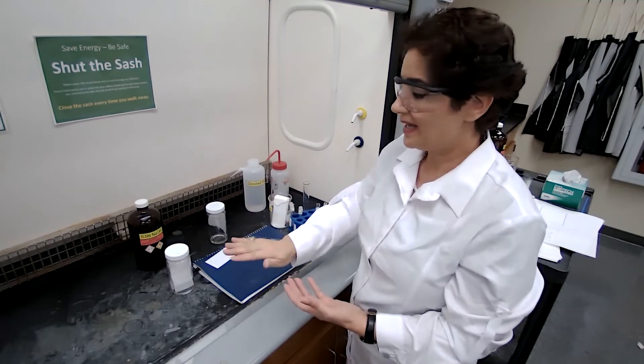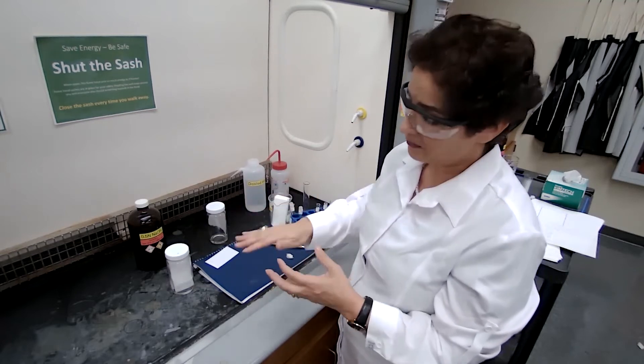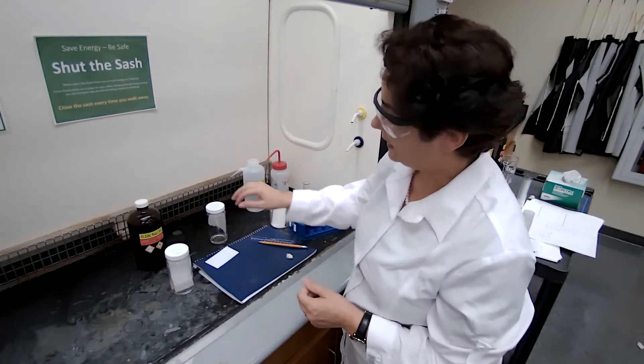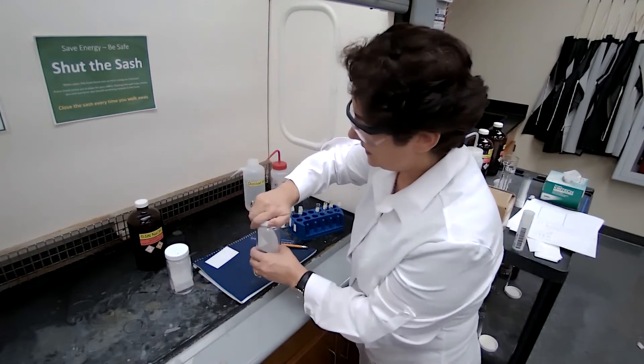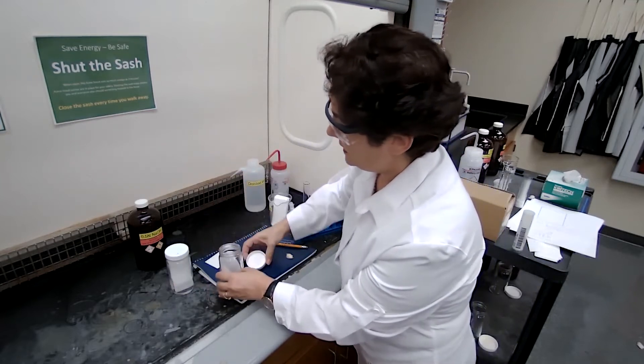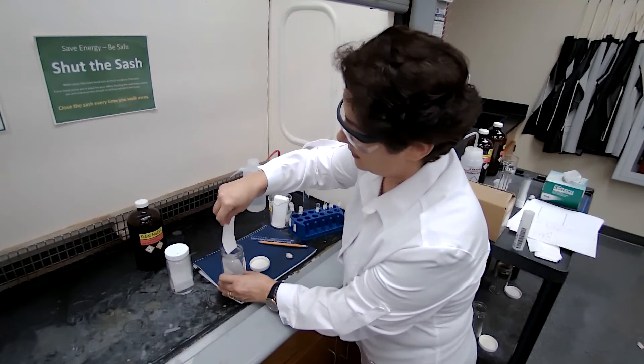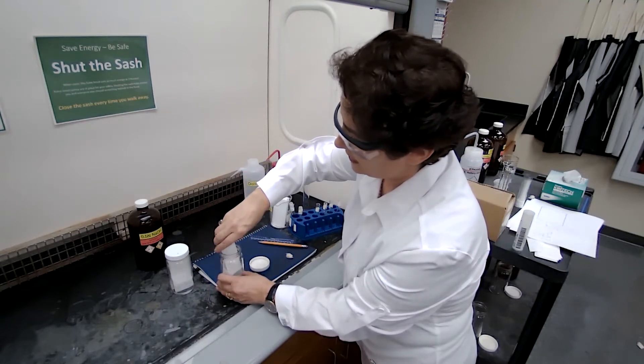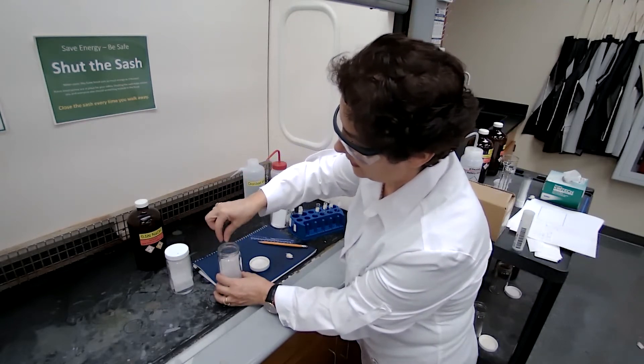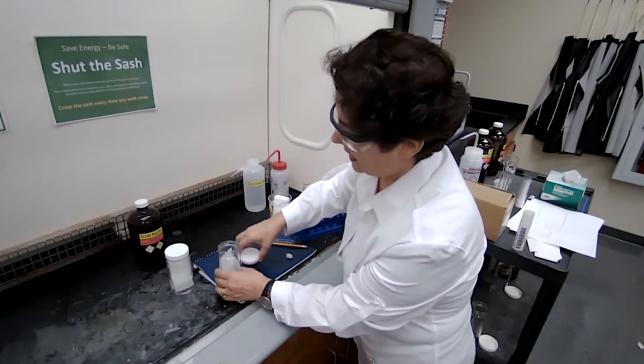And you would see a line that is not very organized, it's not a straight line. So I'm going to use my second trial sample also, place it in the next developing jar, touching the side of the TLC plate only, and let it develop.